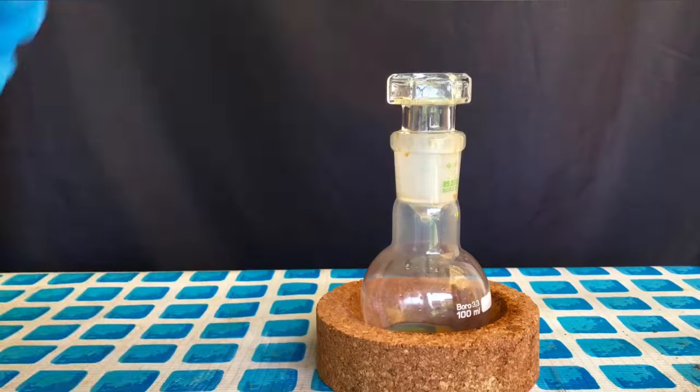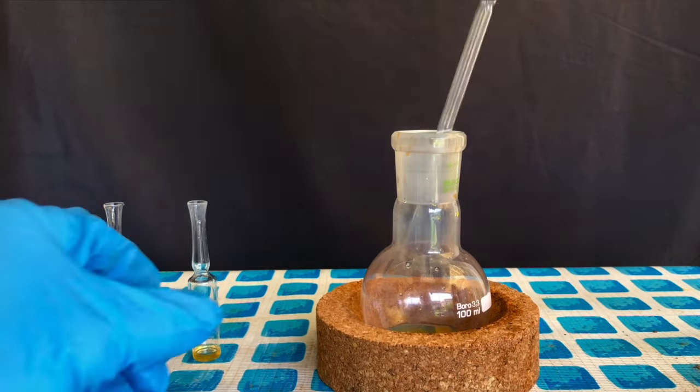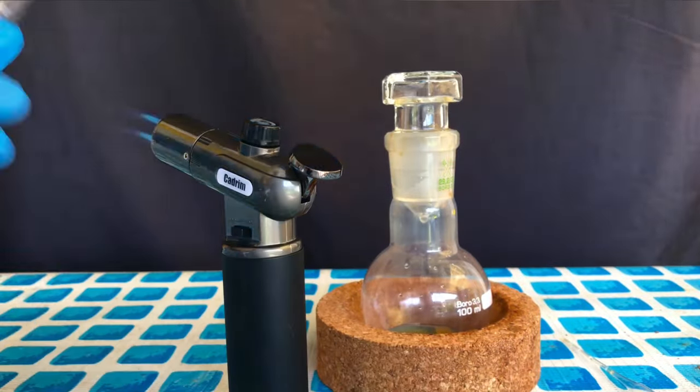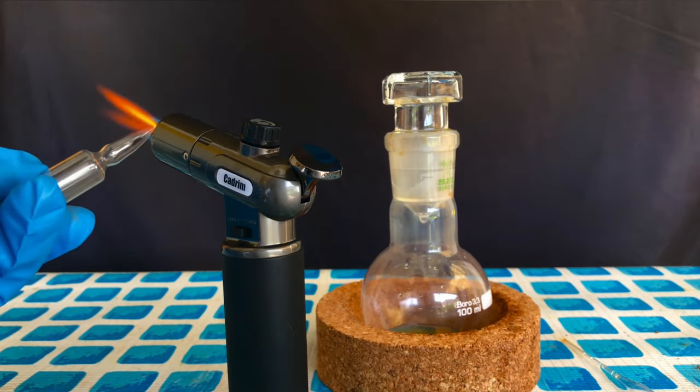For long-term storage, ampoules are always the best choice. I always make sure, however, to pre-weigh my ampoules in order to determine the yield.